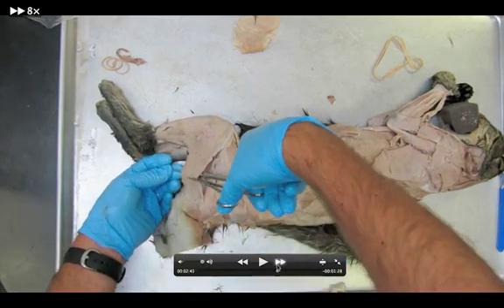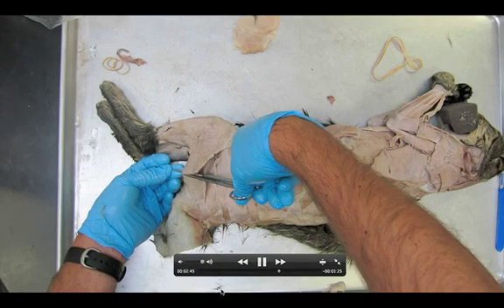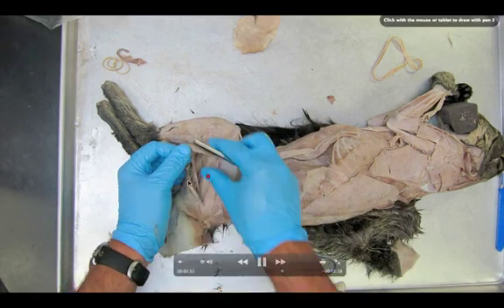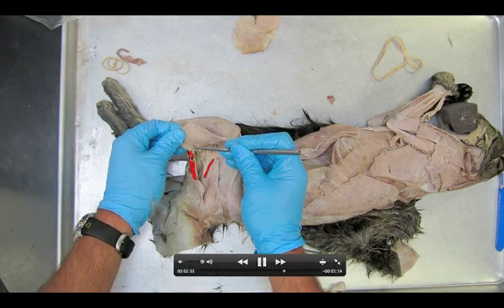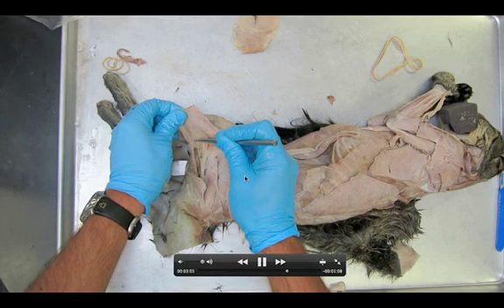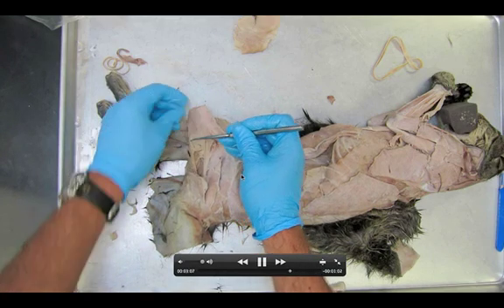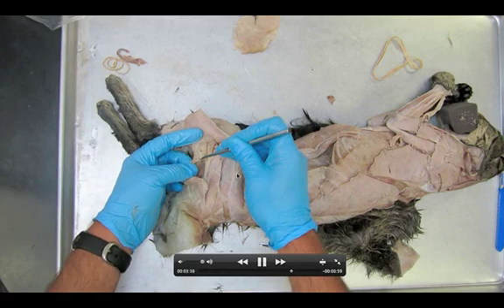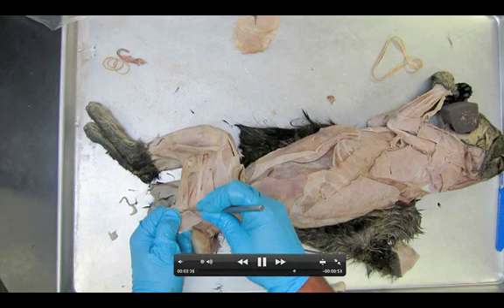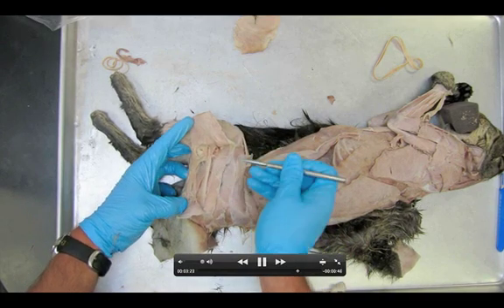You can see my two muscles here. Right now I'm cutting it right along the midline. Now be really careful when we peel them apart — you should hopefully see both of these structures: the sciatic nerve and the tenuissimus. I'm carefully peeling it down from the biceps femoris on one side, and then I'll do the same to the other. Carefully pulling it down — this guy is actually thinner than the brachioradialis, a very, very delicate little muscle. The sciatic nerve is this big white nerve that you can see, and then there's the tenuissimus.